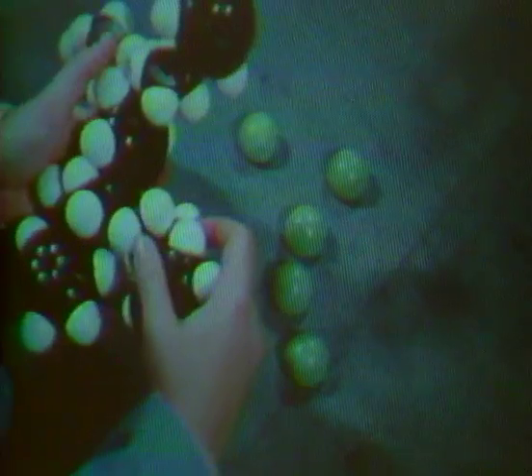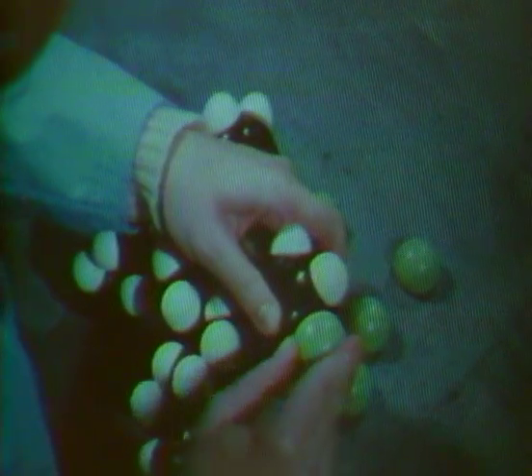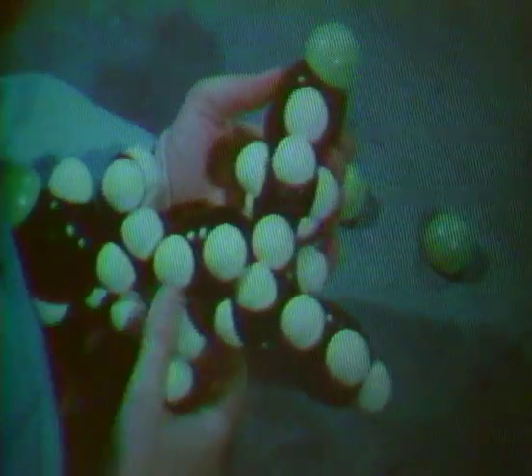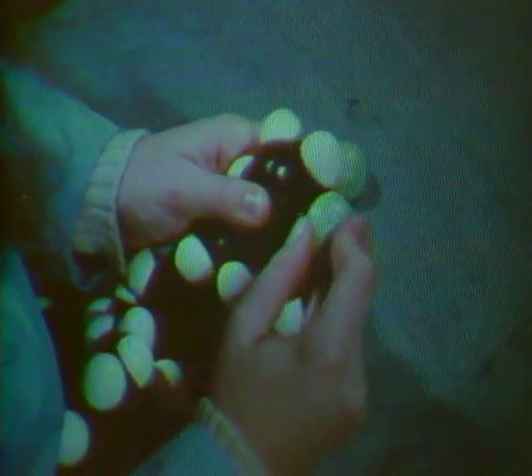The solid consists of small beads of a cross-linked polymer that produce a sponge-like network. Distributed throughout it are ionized groups capable of exchanging either cations or anions depending on their compositions. If these groups are highly ionized, we speak of strong exchangers. If the resins are only slightly ionized, we speak of weak exchangers.